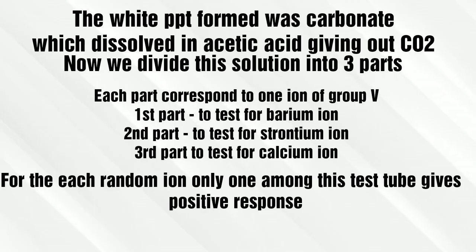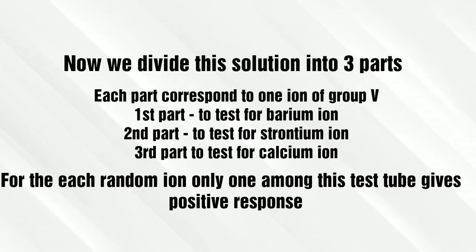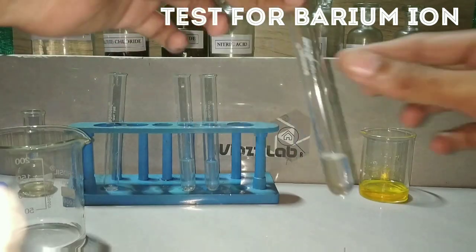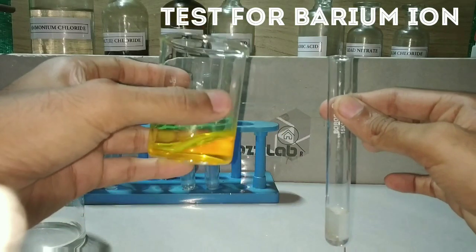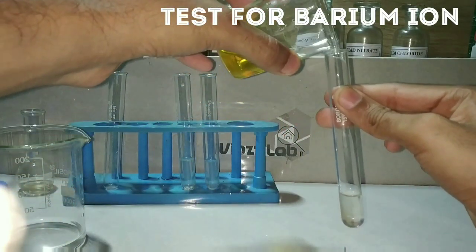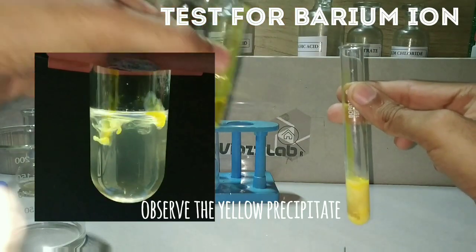The white precipitate was the carbonate salt of the Group 5 cations. After dissolving it in acetic acid, we divide it into three parts. The first part is for testing barium ions — we take that solution and add potassium chromate into it.